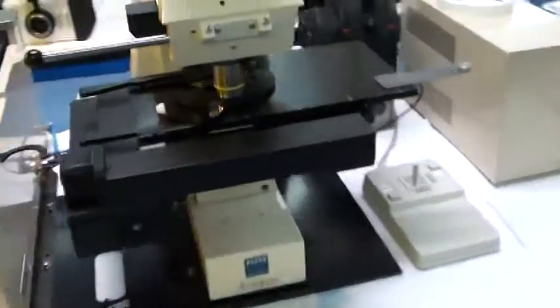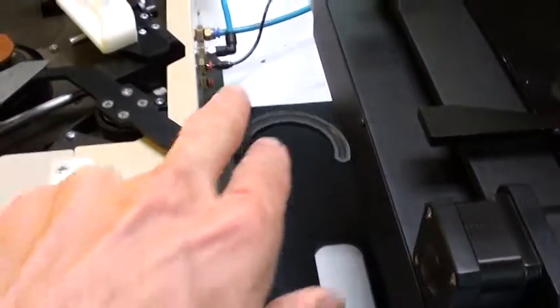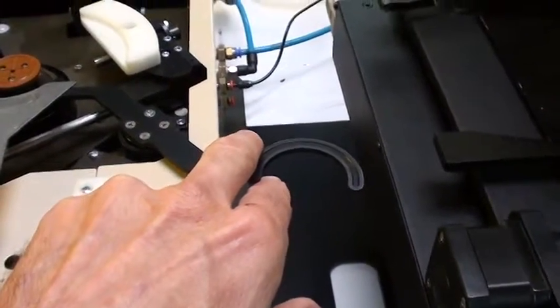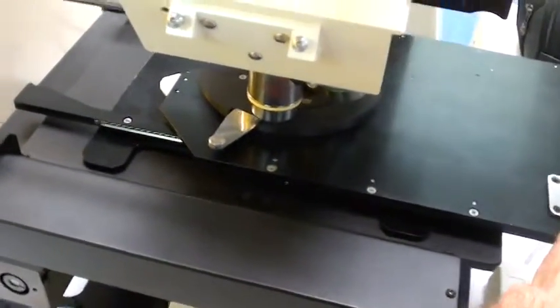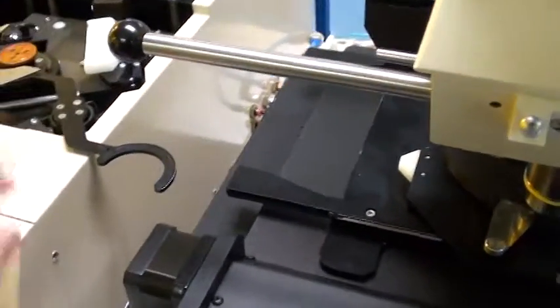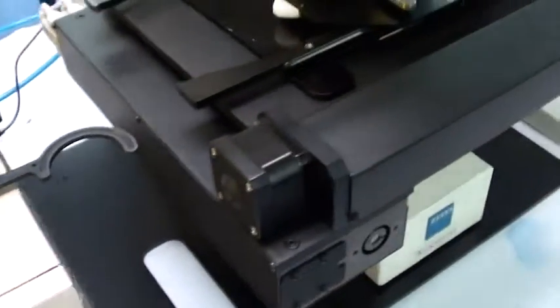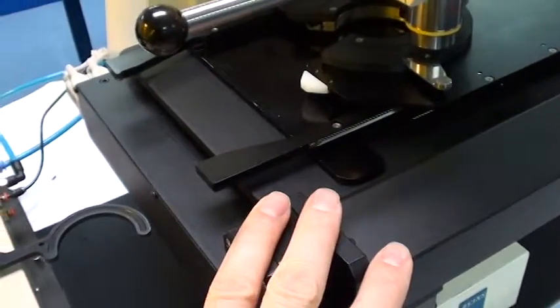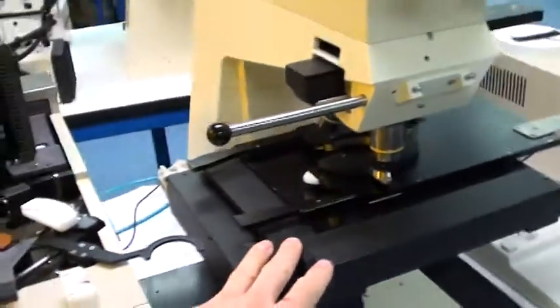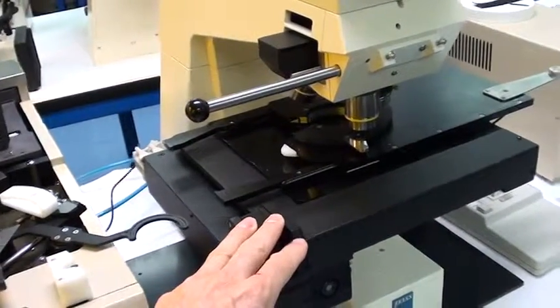The first thing to consider is that there is one rather vulnerable part of this system, and that is this transfer arm, also known as the F arm. It can be rather easily damaged. So special care has to be made to ensure that when you first start up this microscope motorized stage, you don't have an interference issue.